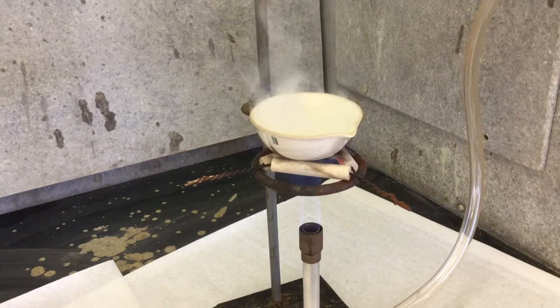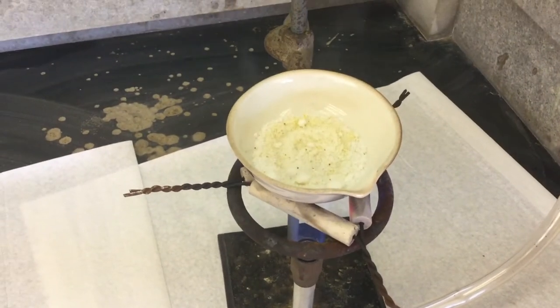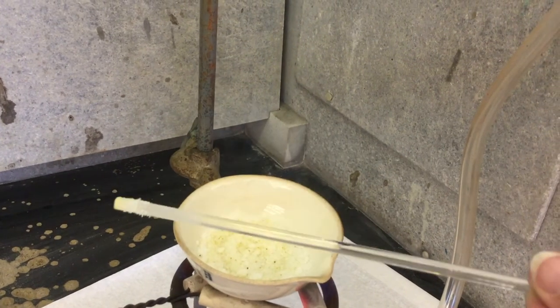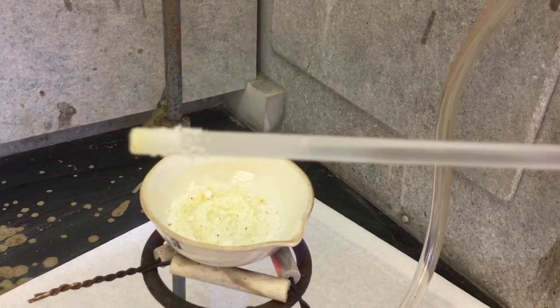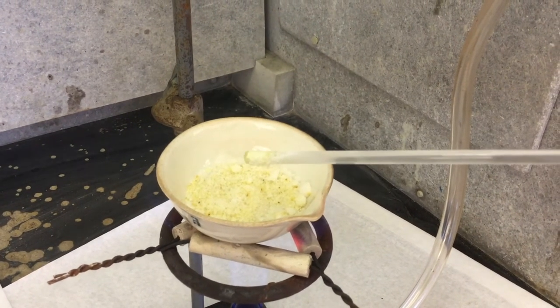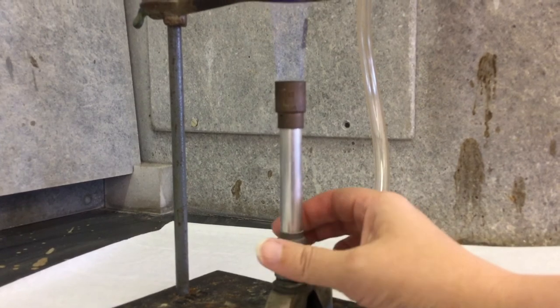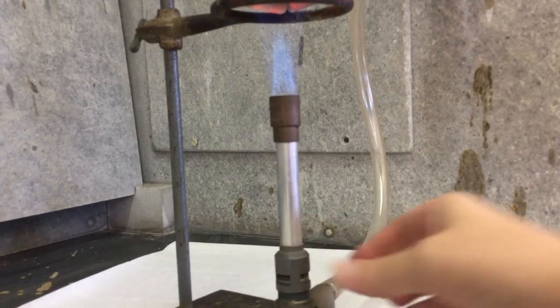Remember that as part of your participation grade, you may be asked to take a picture of the sublimation that is going on. You may notice that the sand and salt mixture starts to turn yellow. If you hold the glass stirring rod over the steam that appears to be coming off of it, you may begin to see a whitish condensation — that is the ammonium chloride that is deposited. We want all of this to be sublimed out, but be careful that if there is any sand or salt on your stirring rod, make sure it goes back into the bowl so it can be weighed. When you can't see any more fumes coming out of the evaporating dish, turn up the heat by rotating the barrel to the left to add more oxygen. You should start to see two cones — a larger flame and a smaller, brighter inner flame.